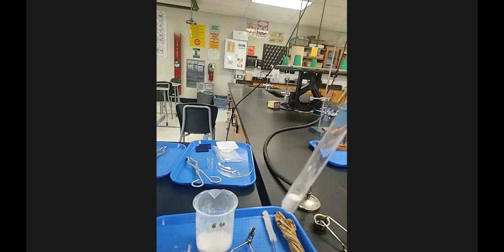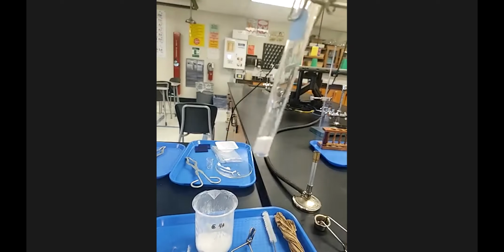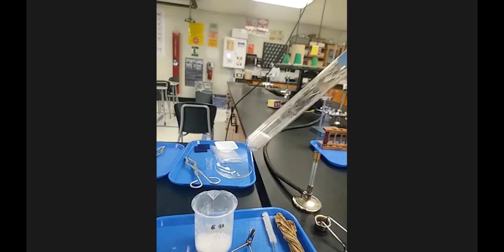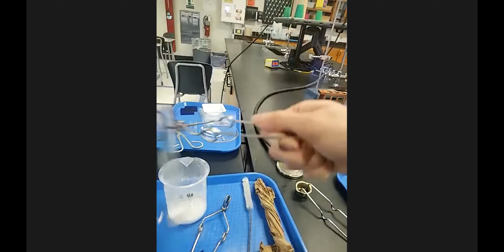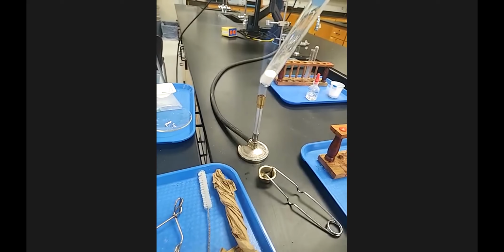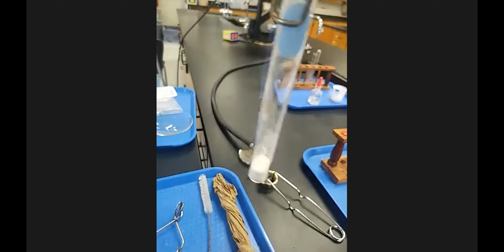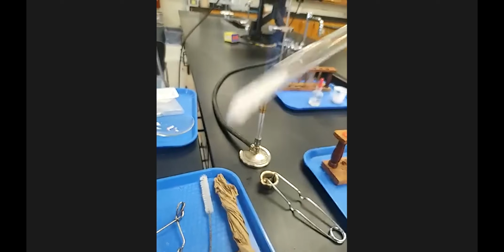Now it does talk about swirling it. If you heat something in a flame and you just hold it like so, you're not moving the solid. Kind of like when I was flicking the test tube to swirl it when it was a liquid, for a solid I want to swirl with a circular motion, like a big loop, going in and out of the flame. Heating a solid in a flame, you don't just want to put it in the flame and hold it there. And you don't want to do it just from the bottom, rotating it. You want it at an angle, and then you want to swirl it.